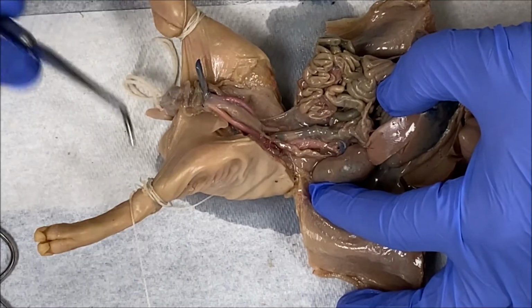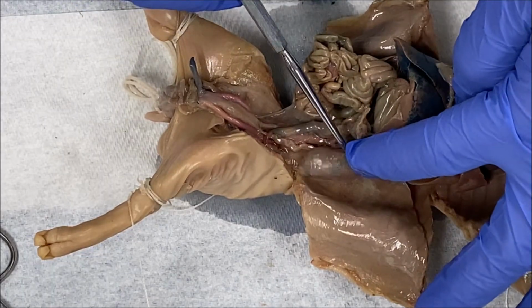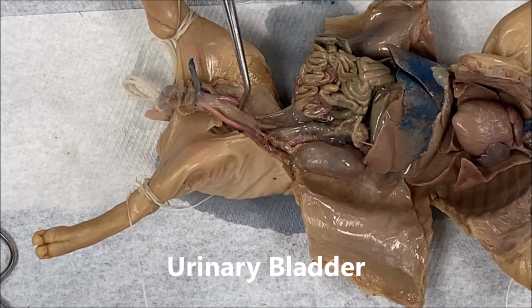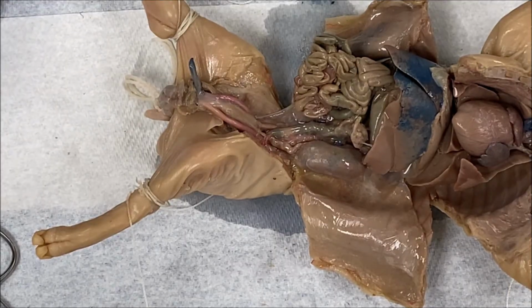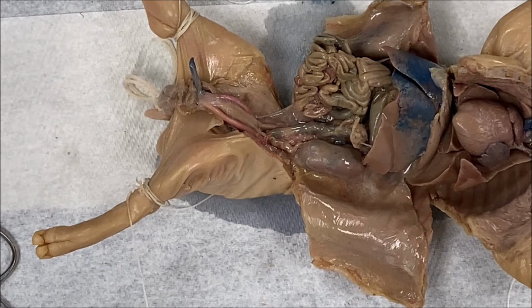Urine is produced in the kidney, and then urine is transported to the ureter, and from the ureter to the urinary bladder, and then from the urinary bladder to the urethra. Those will be the external structures of the urinary system that you'll be responsible for identifying for this dissection.